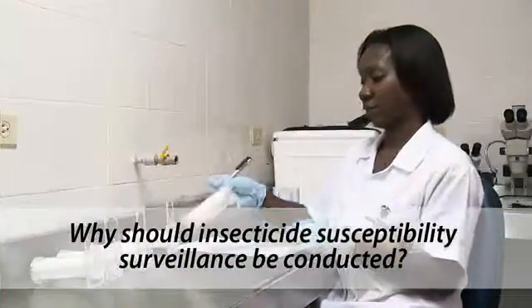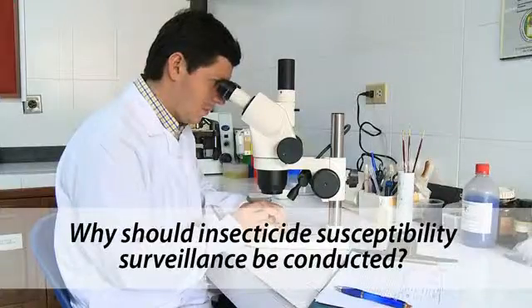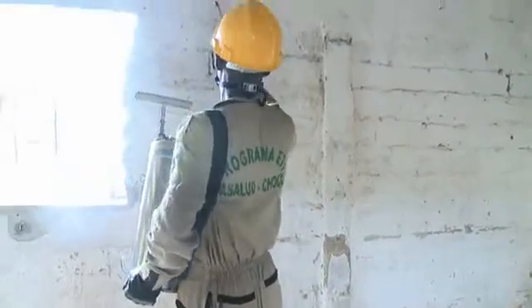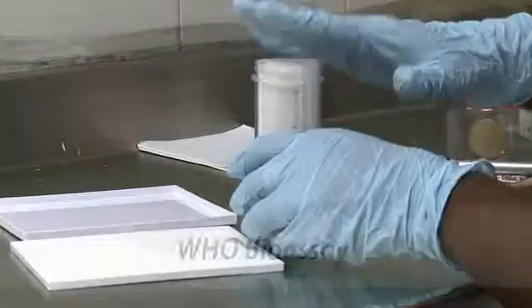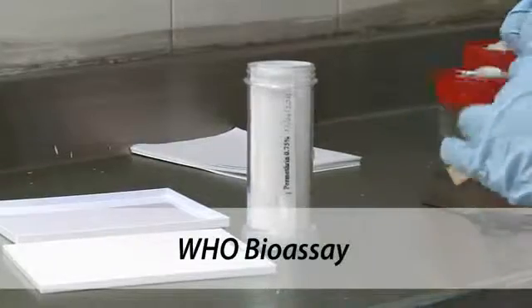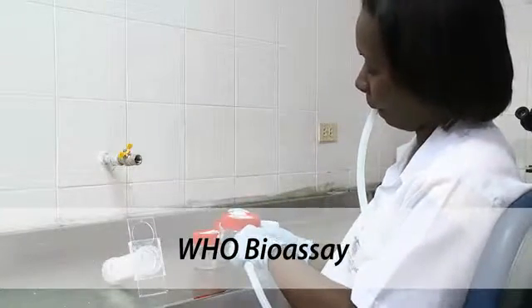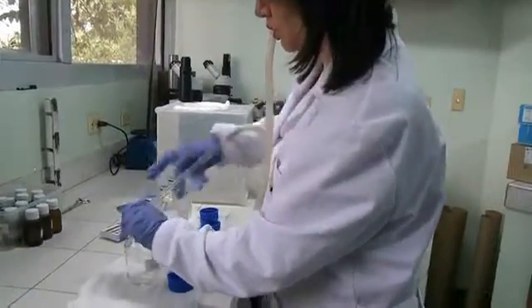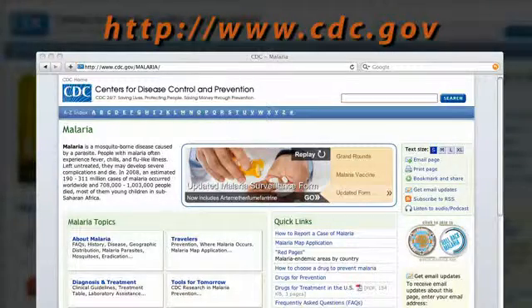Surveillance of insecticide susceptibility is very important because, along with insecticide efficacy tests in the field, it allows regional and national disease control programs to make decisions about pesticide use. There are two methods for conducting susceptibility tests: the WHO method, which uses tubes and insecticide-impregnated papers, and the CDC method, which uses glass bottles and insecticide. To learn more about the CDC method, visit their website.